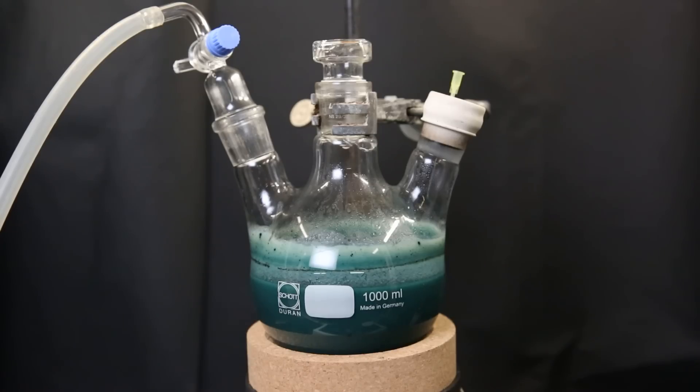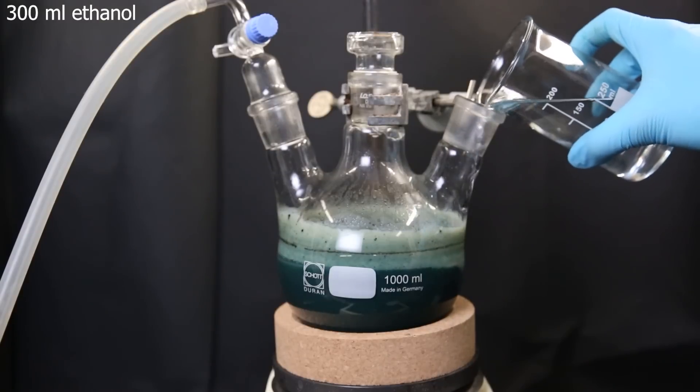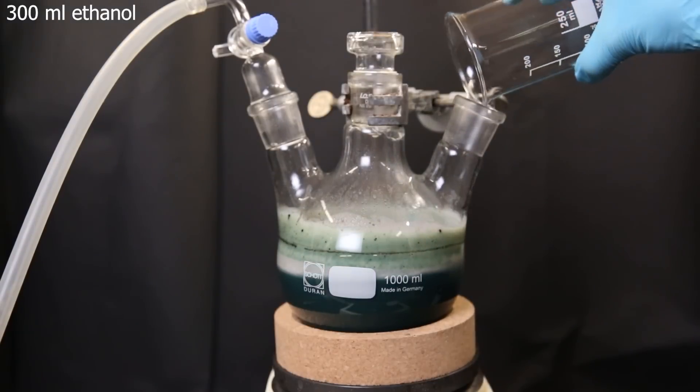So after 1.5 hours, the mixture looks like this and the reaction should be finished. So I quench the reaction by pouring in 300 ml of ethanol in two portions.